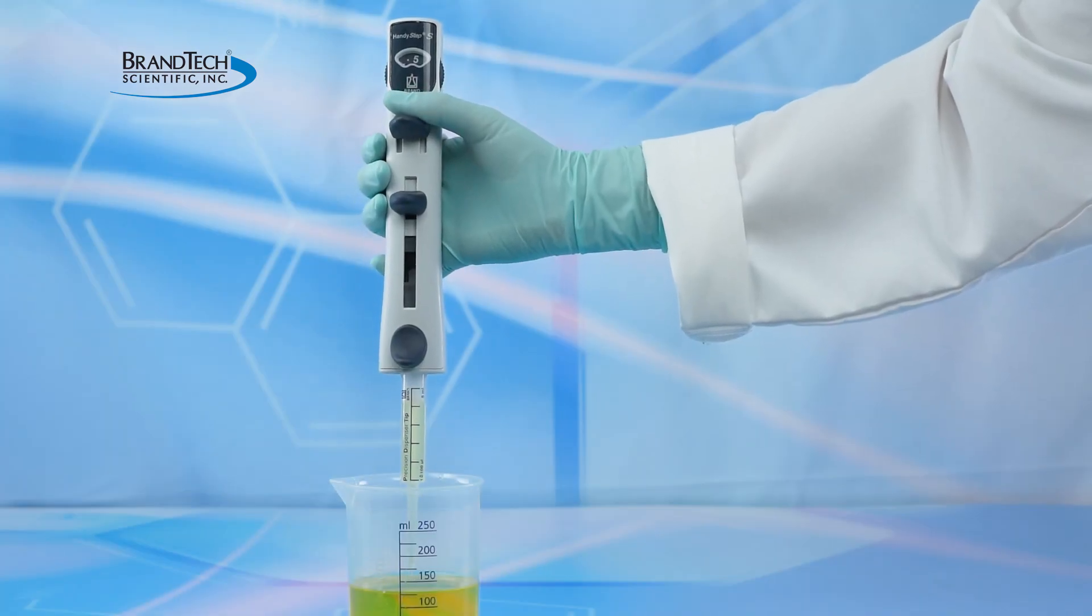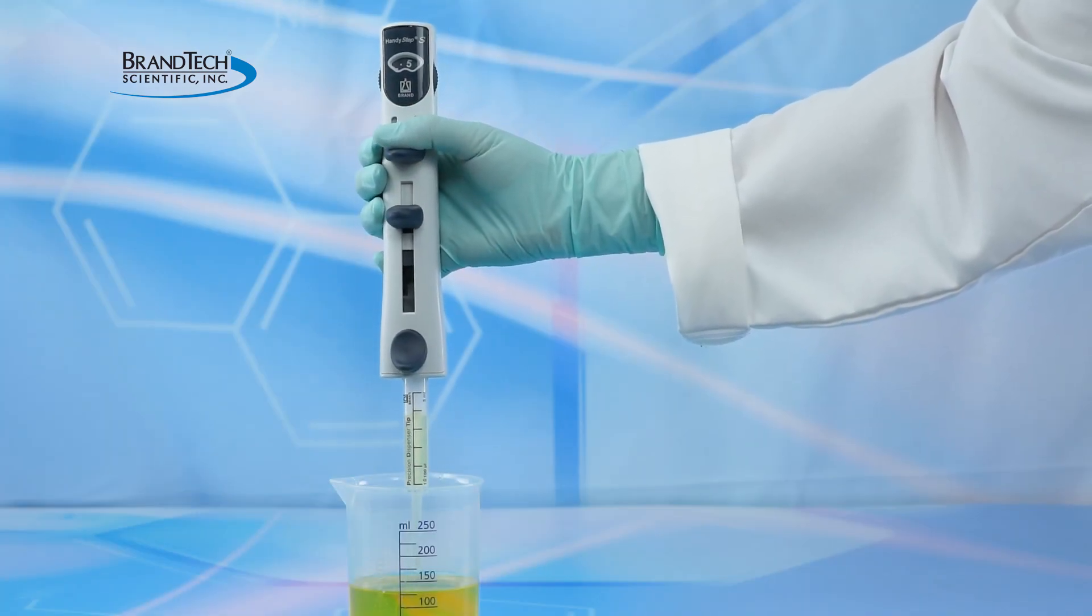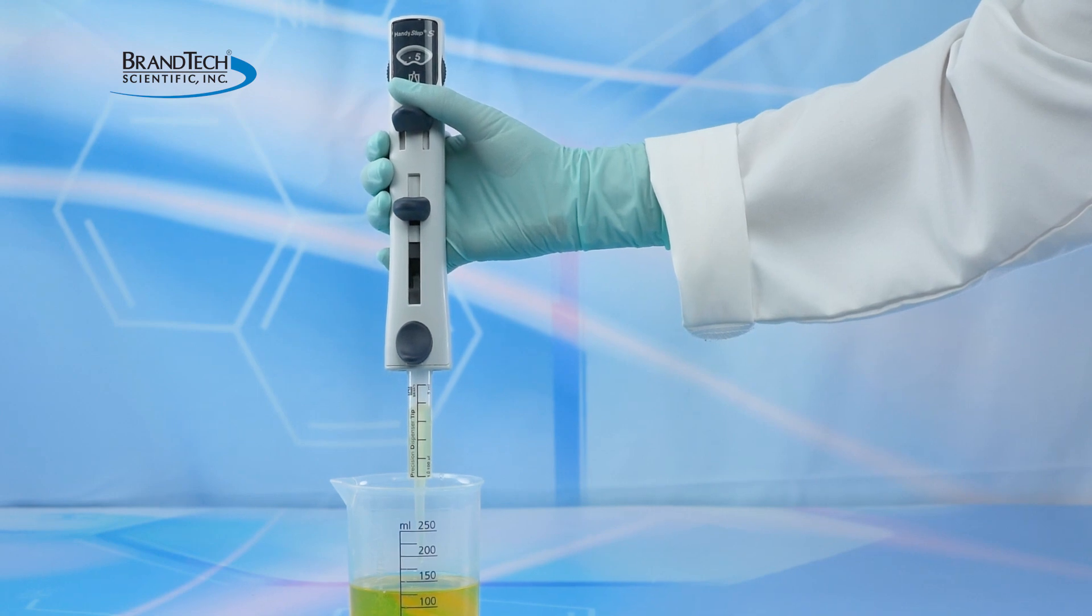Once the PD tip is filled, discard the first dispensing to align the stepping mechanism. The HandyStep S is ready to be used.